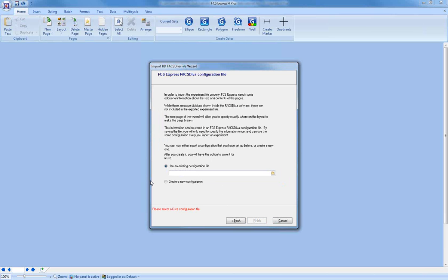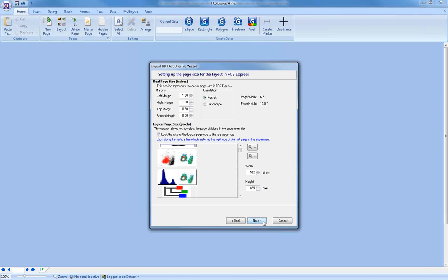Okay, the next question that you get in the import wizard is what configuration do you want to use? Now the configuration, all this means is how do you want the plots to be laid out on the page. So Diva does not include information about how the plots are laid out, or specifically what pages they should be on. So FCS Express has to ask this question. If you click around here, you can actually see that these page borders change. You can just go back to something that looks like it'll fit everything on the page.